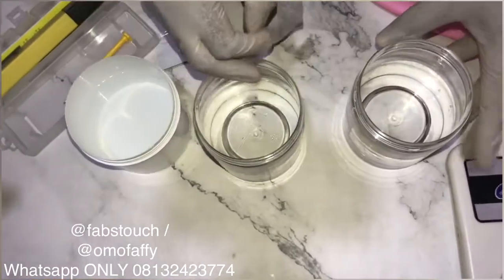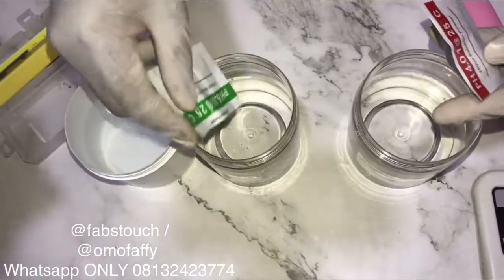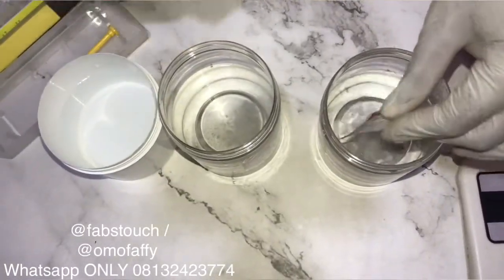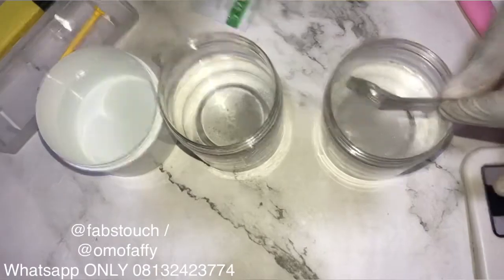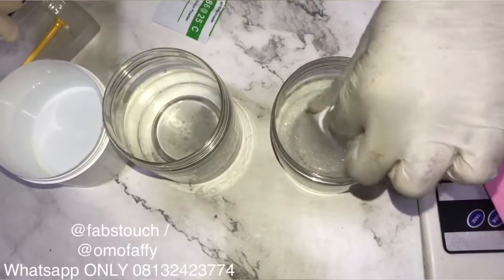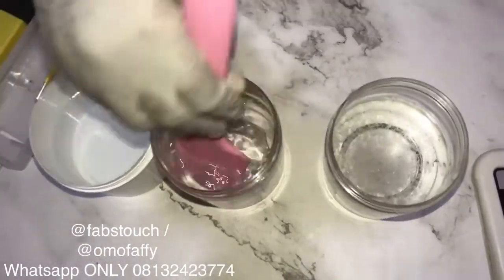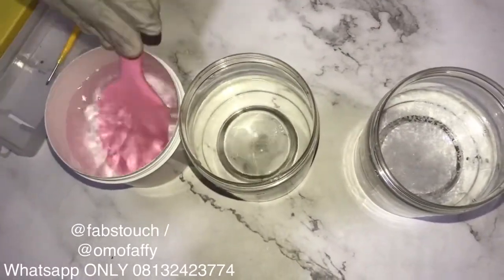The third cup is for washing any utensils I put into these jars. The first thing is to empty your buffer powders into your 250ml of distilled water. Please make sure you use very clean distilled water for this. After pouring the powder into each jar, stir it up, and ensure you wash your spatula between each container so you don't contaminate the other solution.